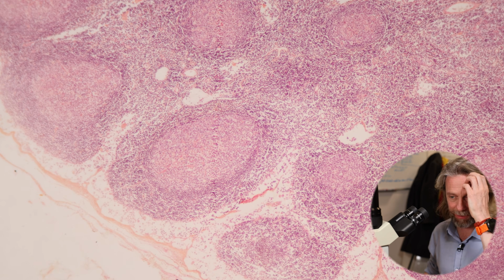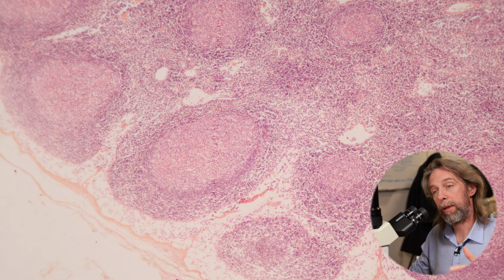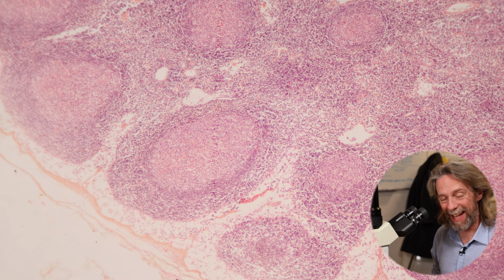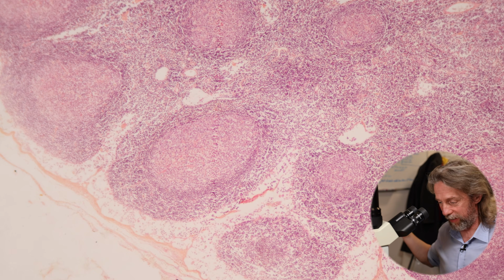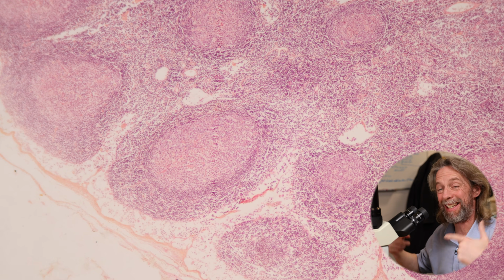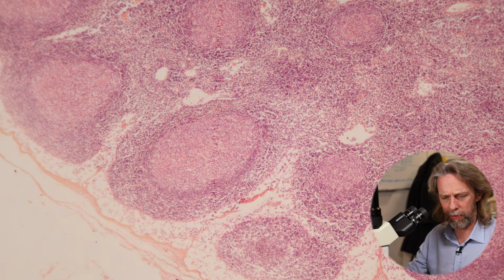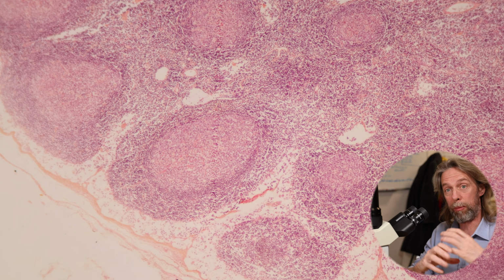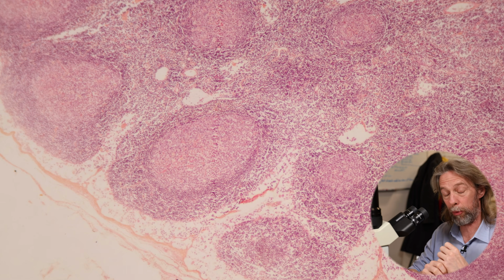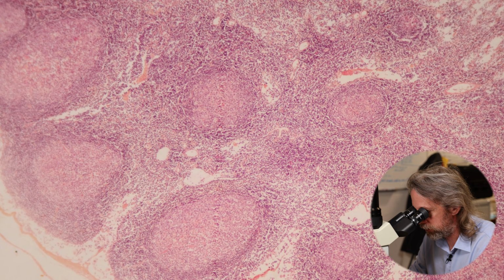Lymph nodes are very interesting to us, not only because we need the immune system to survive in this environment with microorganisms that are constantly trying to attack us and invade us, but also because metastatic cancers that form in a tissue elsewhere in the body can pass through lymphatic vessels and into a lymph node where they tend to get stuck, and then they grow, so lymph nodes become enlarged. Because we're looking at the cells of the immune system here, if an immune response is occurring, the lymphocytes will proliferate, so the lymph node will also enlarge in a normal response to an infection, right?